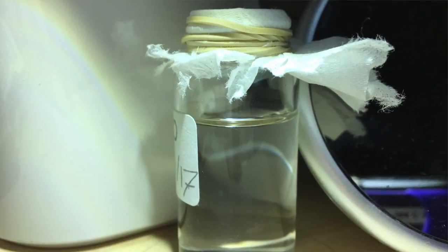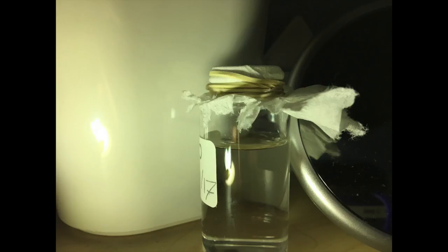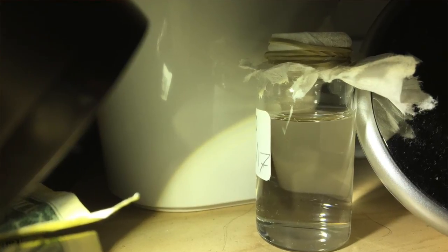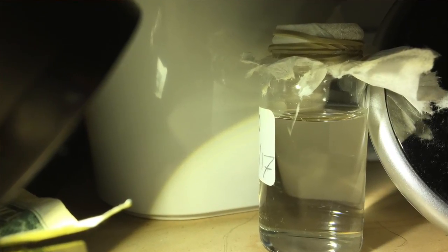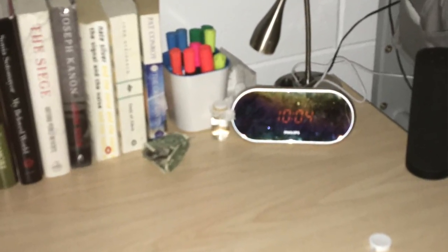There are currently no visible crystals. This means that I am unable to comment on the shape or the size of the crystals at this time. Crystal formation has possibly started on the microscopic scale and not yet reached the point where it is visible to the human eye. This is because it takes a long time for crystals to bond in an orderly way to form the near-perfect geometric shape for which we are aiming.